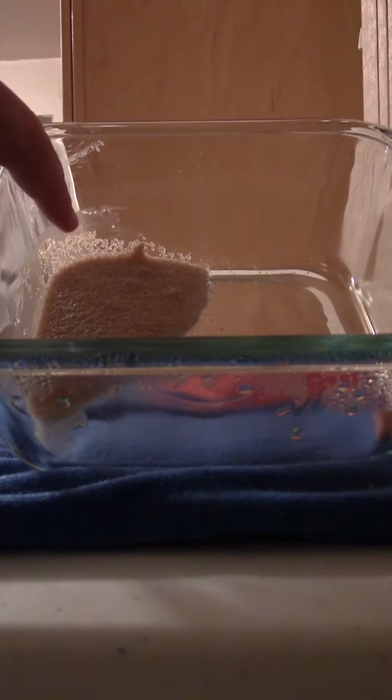Bromothymol blue turned yellow, and the yeast did raise. I can see the line here. I can see some bubbles that formed in it because there's some little holes there. Yeast performed anaerobic respiration, and the evidence is that it gave off carbon dioxide gas because the bromothymol blue turned to yellow.